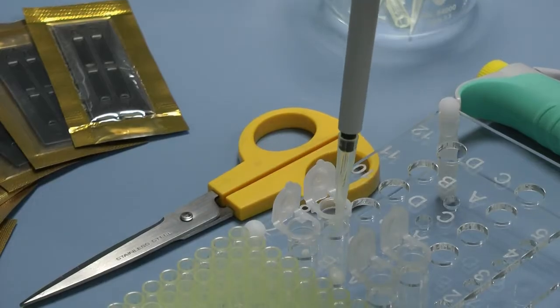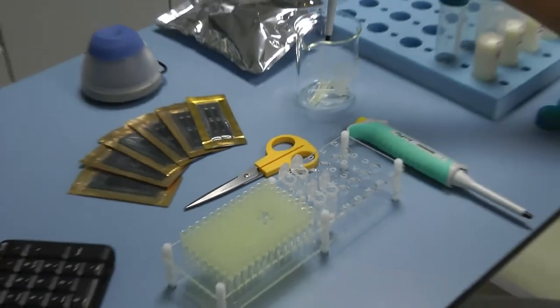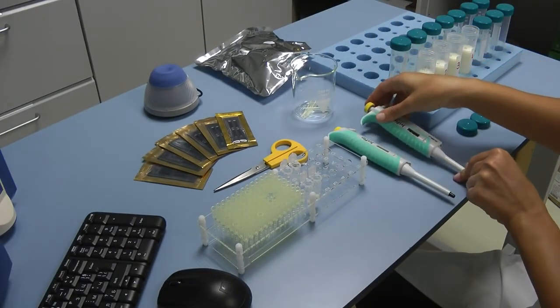Release the button to its initial position. Press the button for removing the tip and remove the tip in an appropriate garbage can.